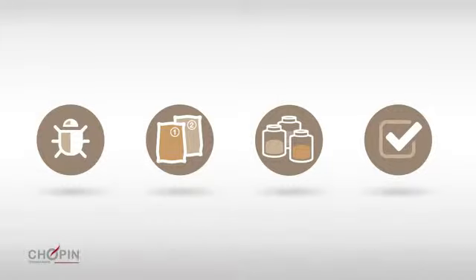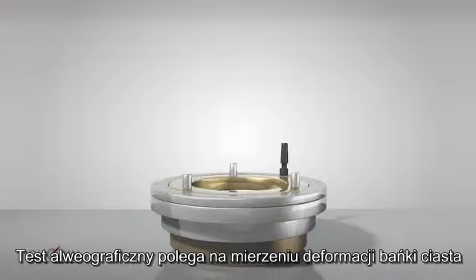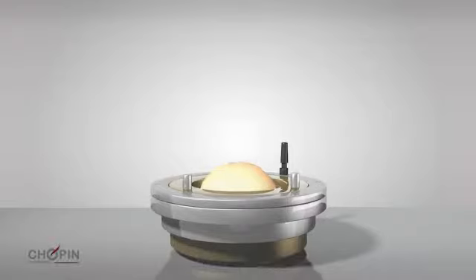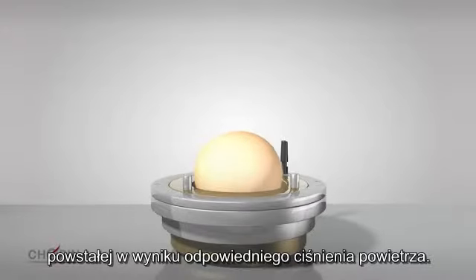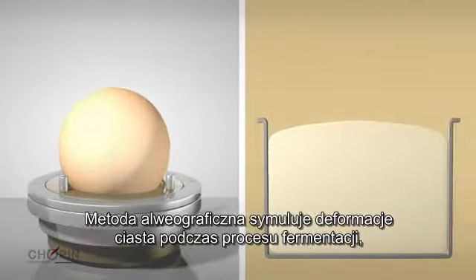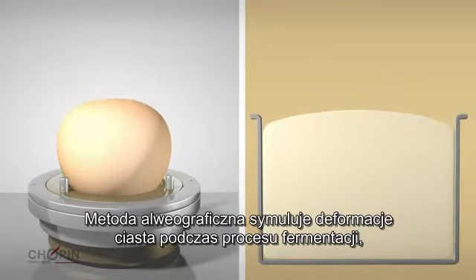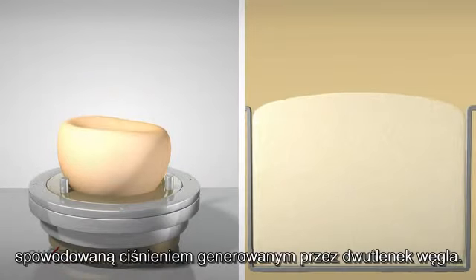An alveograph test involves measuring the deformation of a dough bubble caused by a specific pressure generated using air. This dough extension method simulates the deformation the dough undergoes during fermentation due to the pressure generated by carbon dioxide.